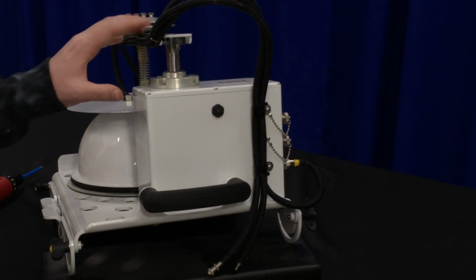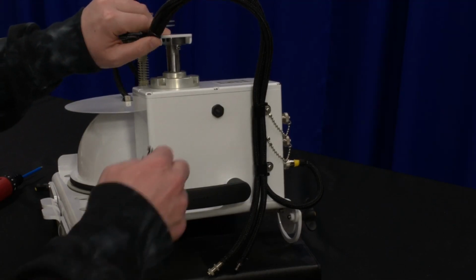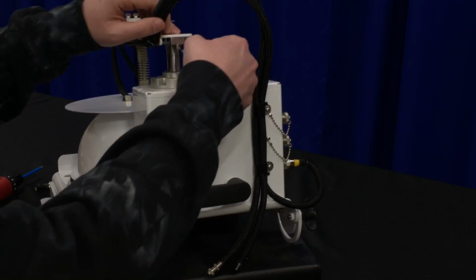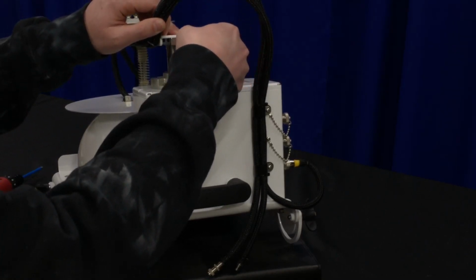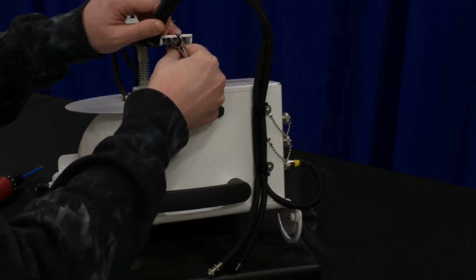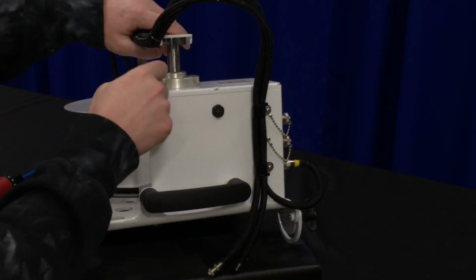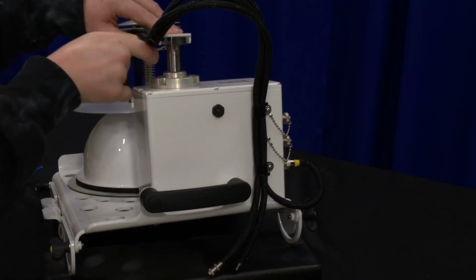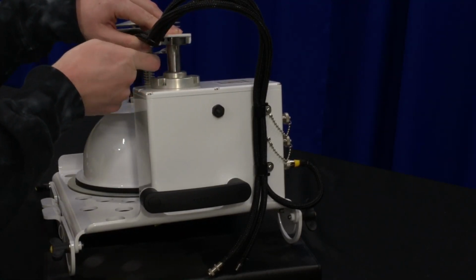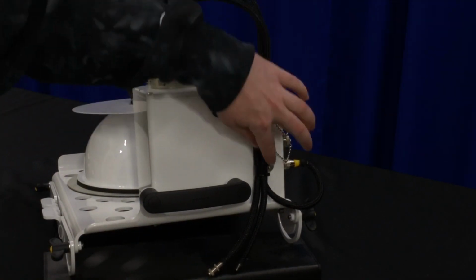If it's possible, put your chamber in the park position. And we'll start with these 2 nuts on the column adapter. And then we'll undo all of this and the screws on the side.